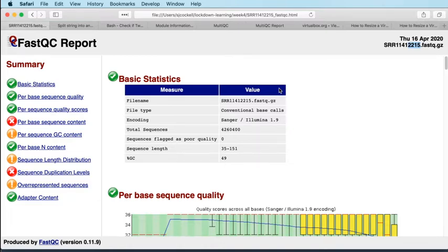On the left hand side you've got a navigation pane, so a sort of general summary with all of the reports that FastQC has generated, and these should hotlink to the places in the file, but they don't appear to be working, which is slightly irritating. But anyway, each one of these is one of the reports that's been generated by FastQC, and on the left hand side of that you have a little icon which tells you whether FastQC considers that this particular test has passed or failed, or whether FastQC gives you a warning for that particular test. And a lot of people's first instincts when they look at these reports is that they want to eliminate those red crosses. They see the red crosses and even the orange exclamation marks, and they want to get rid of those things.